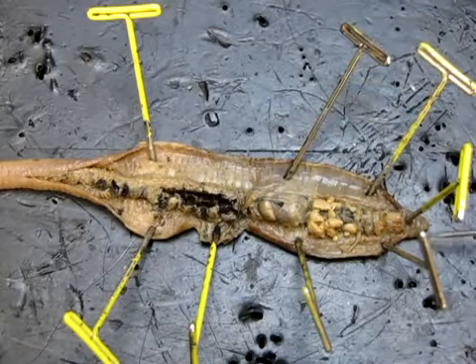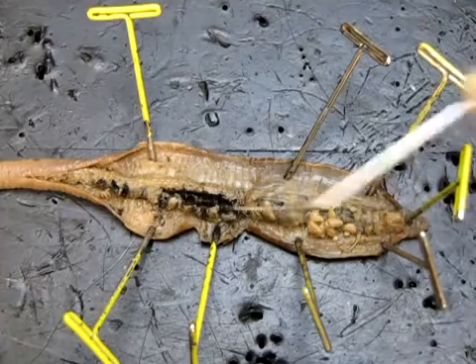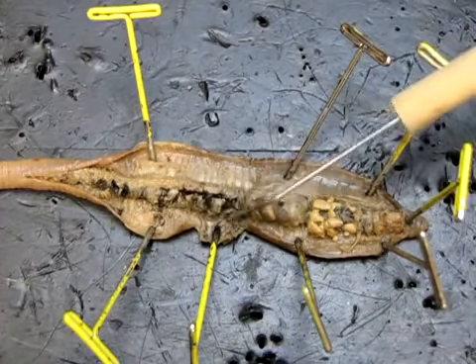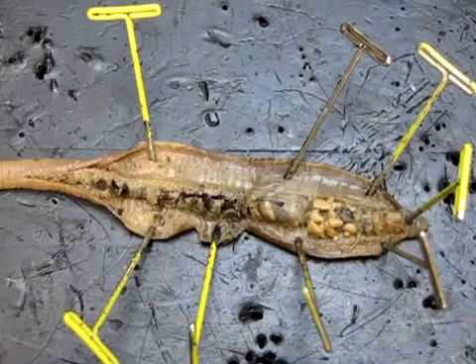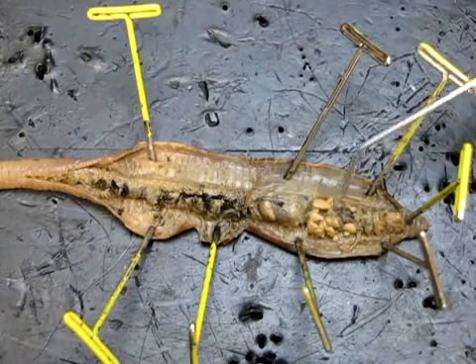Earthworms, you may recall, ingest soil, and they extract organic nutrients out of the soil, so little bits of, say, plant material and that sort of thing, which has been partially decomposed. So these guys are excellent decomposers and very important for adding nutrients into the soil as well. So that's basically the digestive system. Let's come back to what's going on up here.